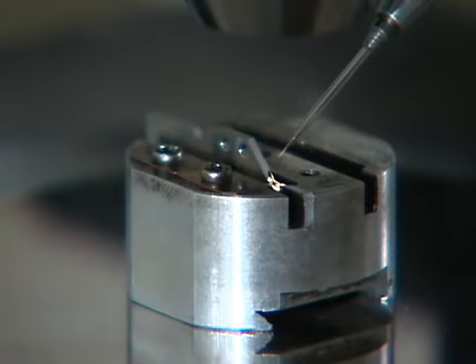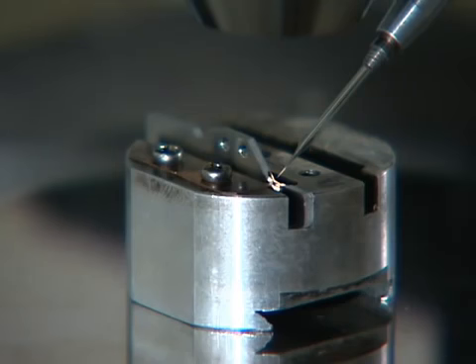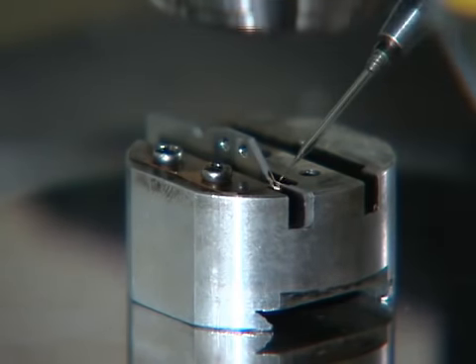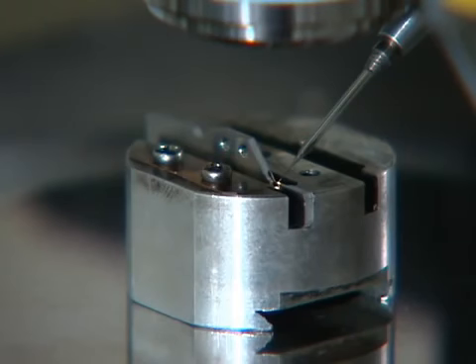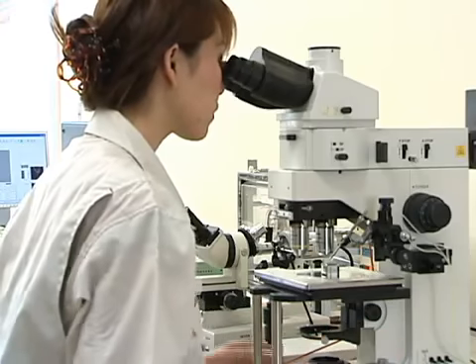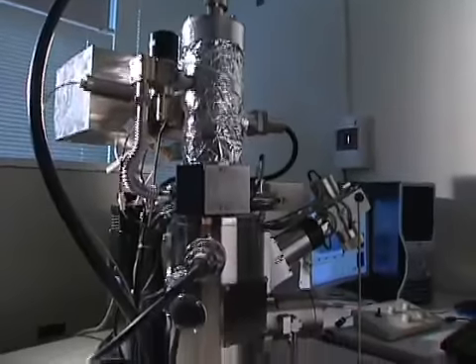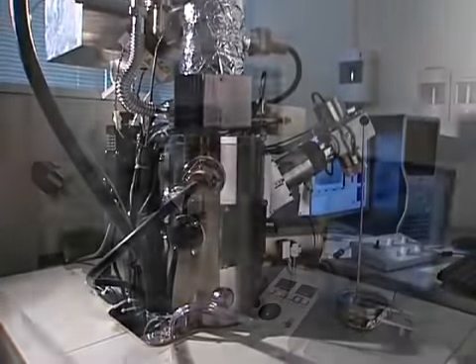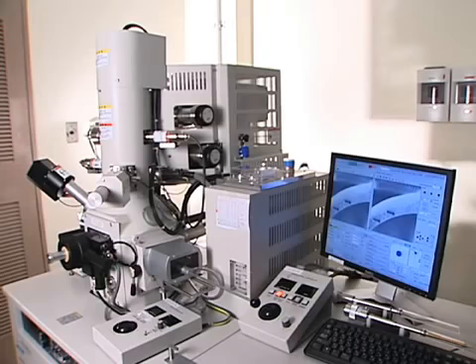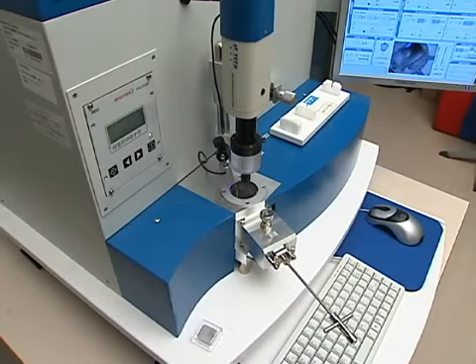The first and important step to electron microscopy is the preparation of specimens, in which the specimen must be thin enough for electron transparency. Even a cooking foil made of aluminum is far too thick for electron microscopy. But you have nothing to worry about. Experts at specimen preparation will create the specimens for you. Here are the different types of machines for specimen preparation. Depending on the substances and purposes, the best machine will be chosen.